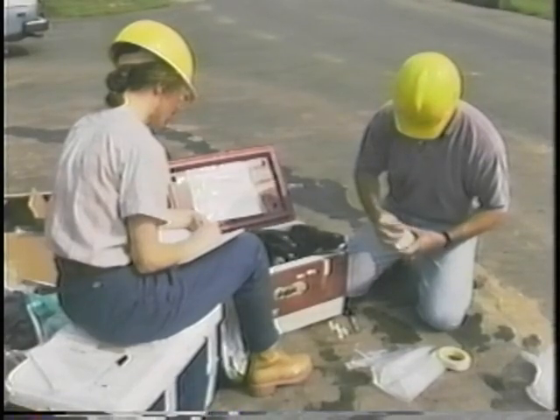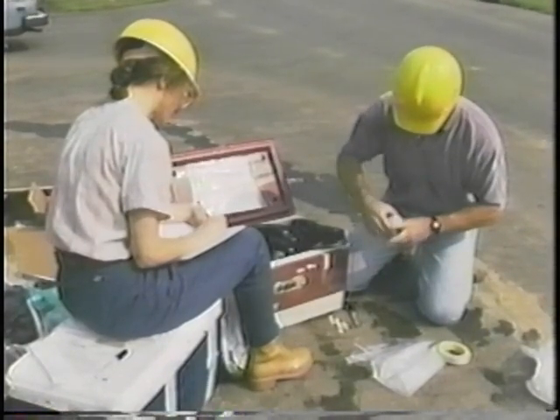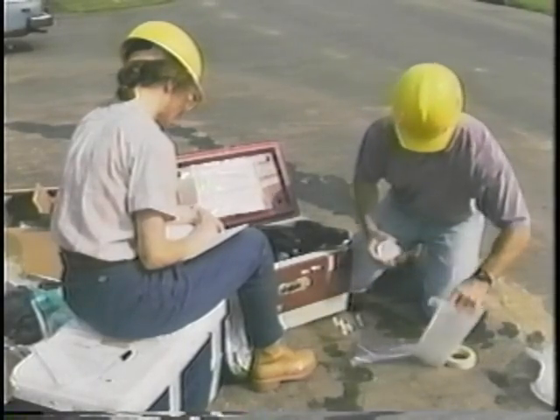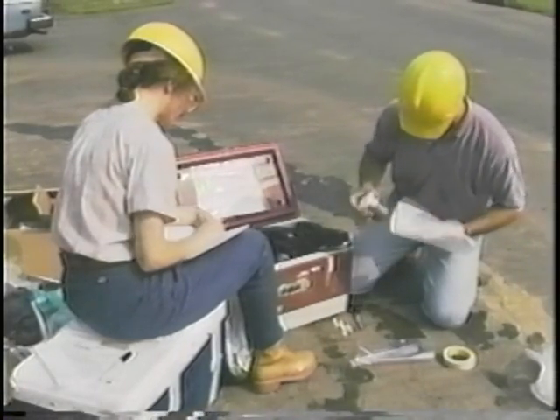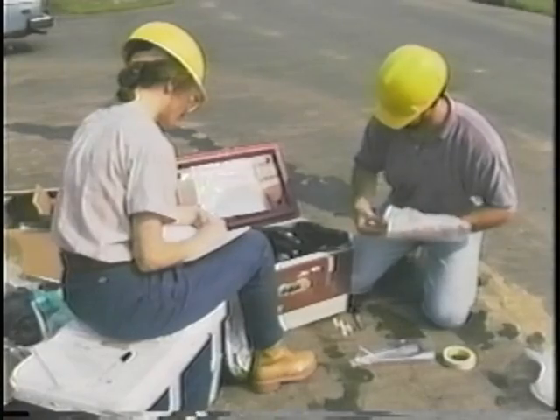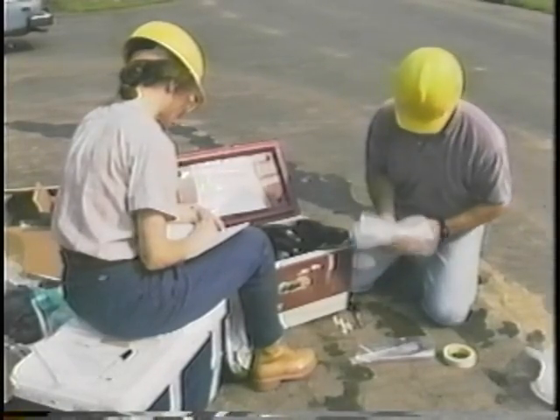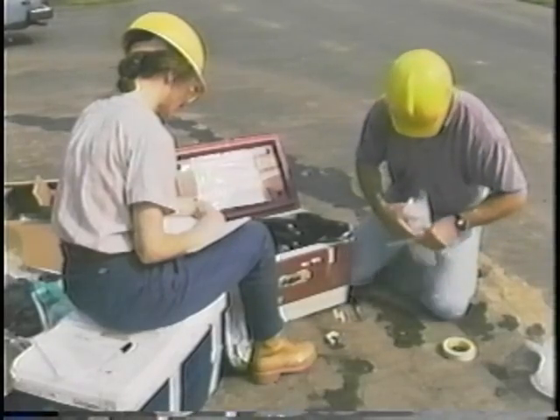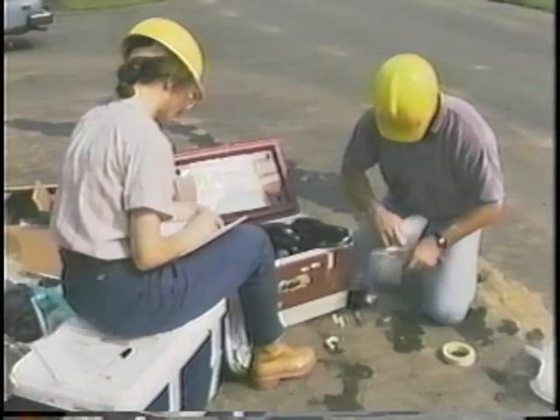Before leaving the facility, each sealed and labeled container should be prepared for transport. Wrap the lid a few times with tape and affix the tamper-proof seal. Wrap glass containers in bubble wrap to protect them from breaking. You may also want to put them in lock-seal bags if you don't use waterproof ink. Then, put the samples on ice in the cooler.